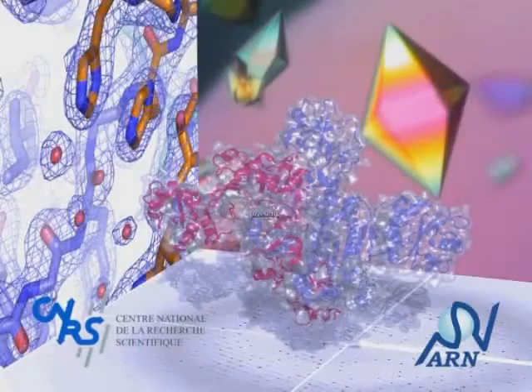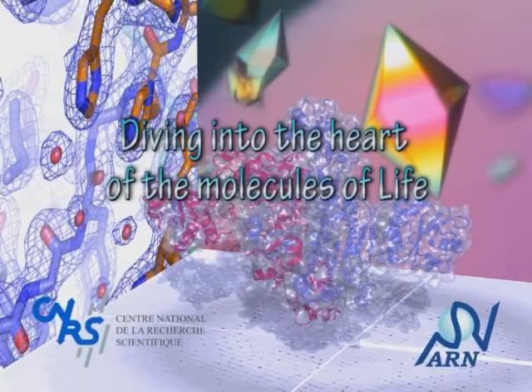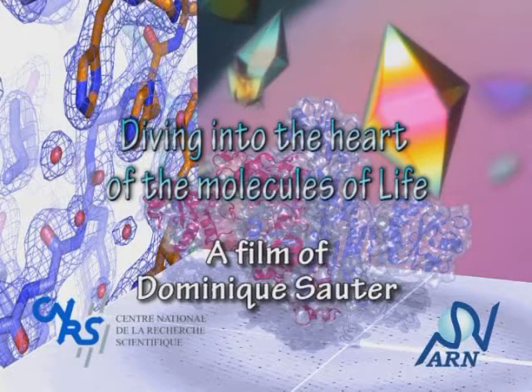The molecules that constitute living organisms, from a simple bacterium to the cells of a human body, are a major focus in modern biology. But these biological macromolecules are too small to be observed directly using a microscope. Gaining images of these molecules is, however, important for understanding what they look like, how they function, and how they interact.